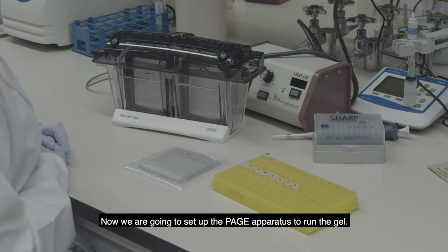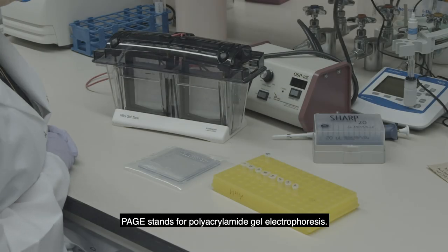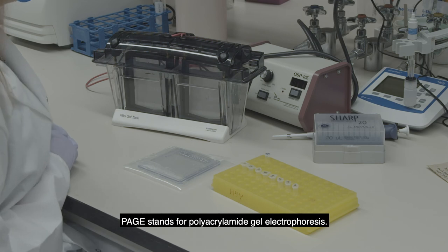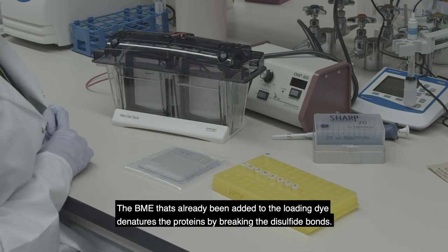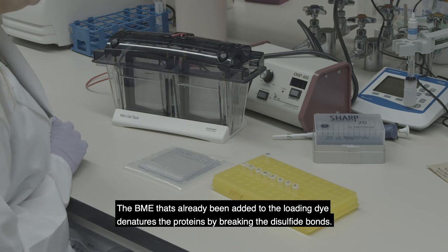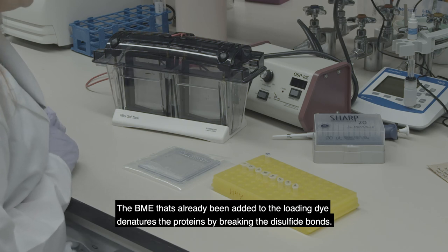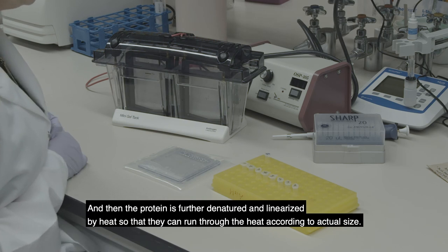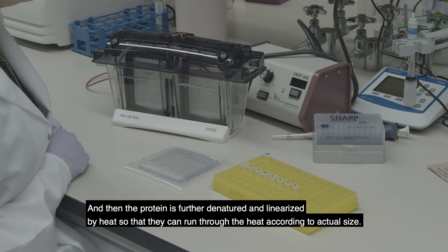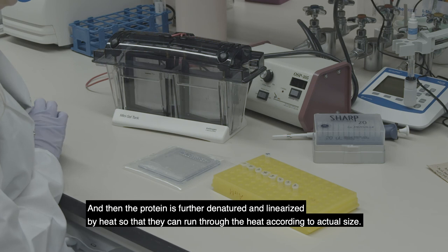Now we're going to set up the PAGE apparatus to run the gel. PAGE stands for polyacrylamide gel electrophoresis. The BME that's already been added to the loading dye denatures the proteins by breaking the disulfide bonds, and the protein is further denatured and linearized by heat so that they can run through the gel according to accurate size.